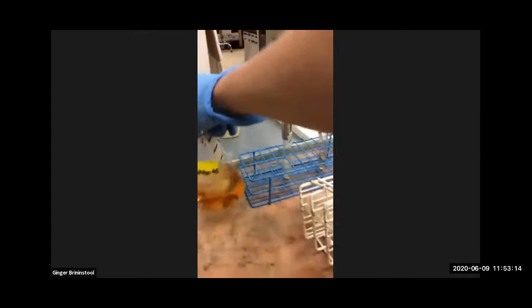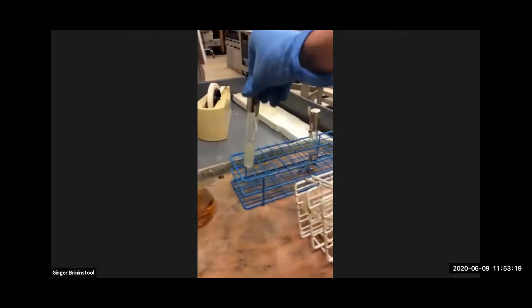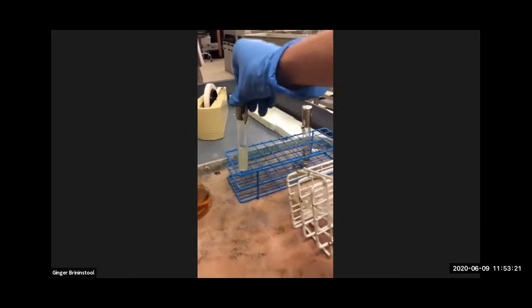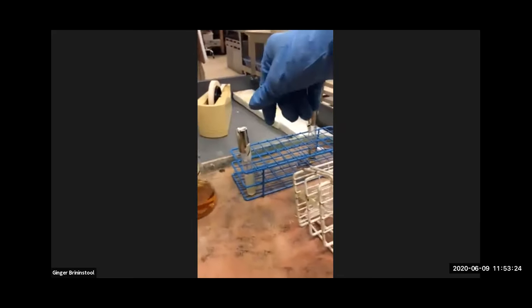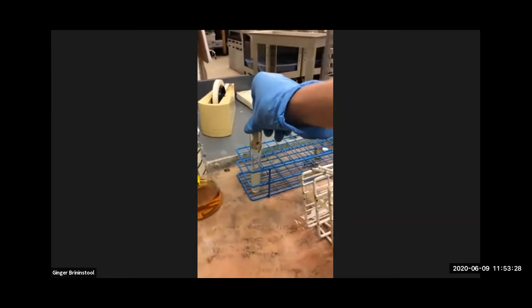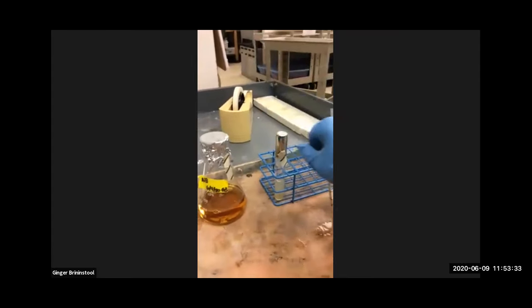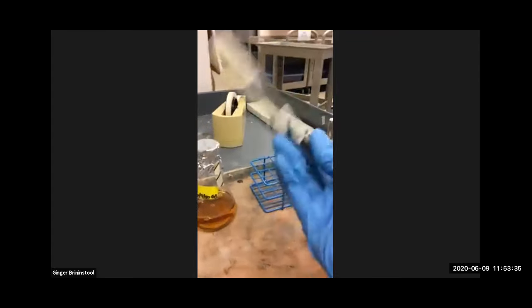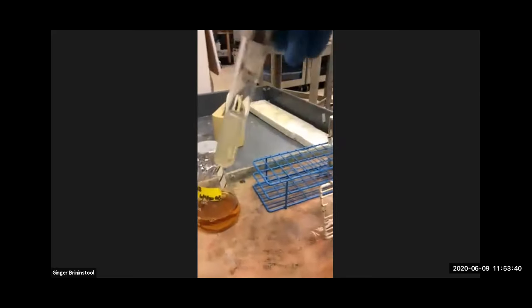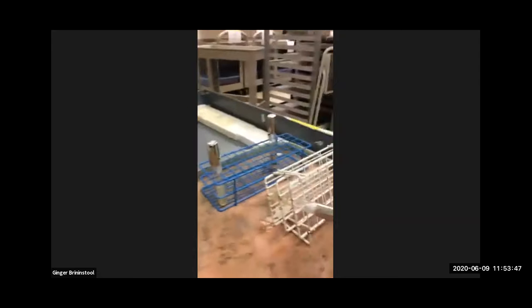Nutrient broth, I already told you, once you make it, it stays broth forever, right? Well, this is an agar deep, and the solution of nutrient agar that I made earlier, I put some in a tube and I let it solidify, let it cool down vertically. And so it made a deep. Now nothing on this is going to move. I'm turning it upside down, right? It's like a plate, but in a glass tube, right? So we will use a deep later in the semester. I'll show you what that's all about.